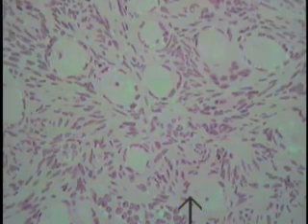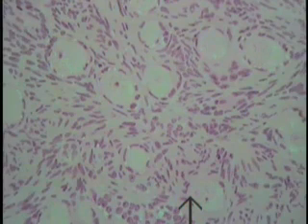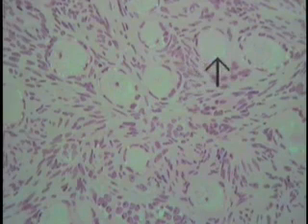Similar structures can be demonstrated in this particular ovum as indicated by the pointer. Note another feature shown in this field: not all of the ova show a nucleus or a nucleolus. In this particular case, we only have a grazing section to the nucleus, and in this section of this oocyte the nucleus is absent — absent only from the field of view, because these cells are so large and spherical that a section may go on either side of the nucleus and it is not visible in a two-dimensional section.